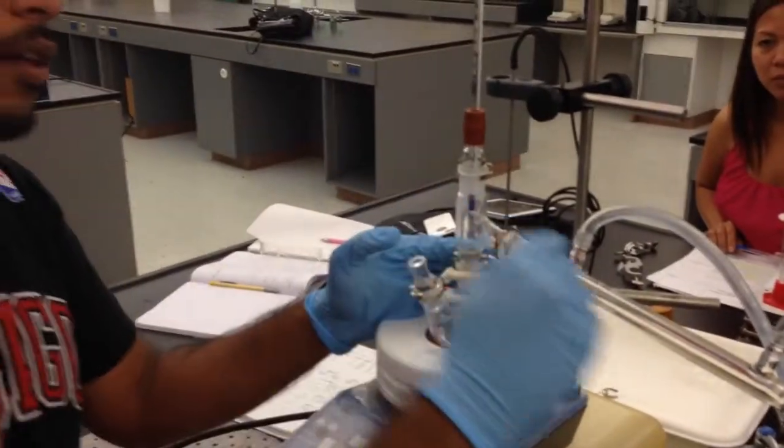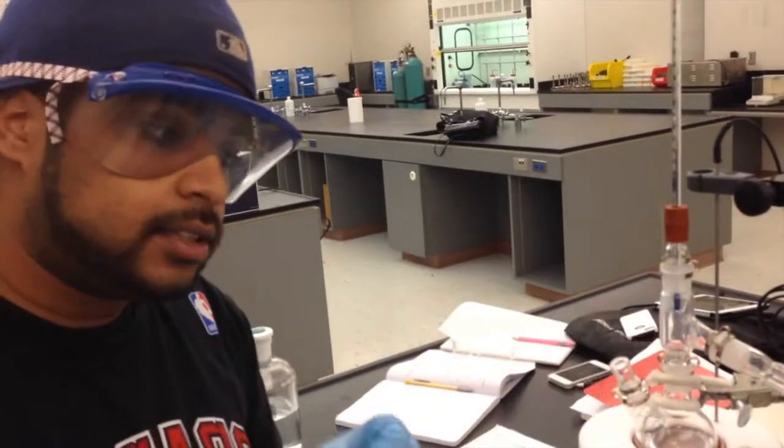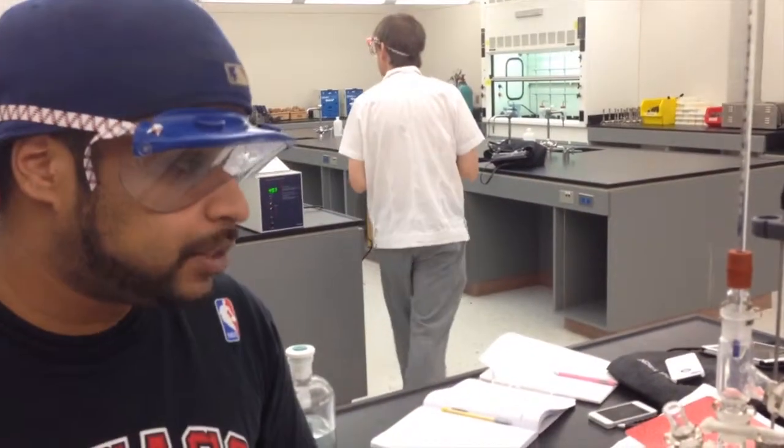Theoretically, if this works the proper way, when it gets to a certain temperature, the only thing evaporating from here should be cyclohexane. Then once all the cyclohexane has evaporated out, the next thing that will evaporate from here will be the toluene. Technically, at the end of it, we should have two separate compounds. Now, in simple distillation versus fractional distillation, that's not exactly the case, and we'll show you exactly why that happens.